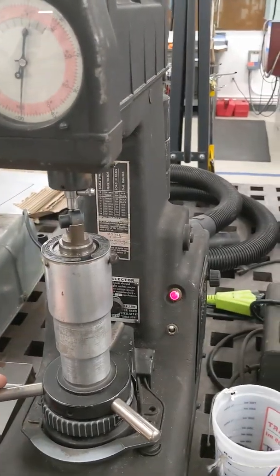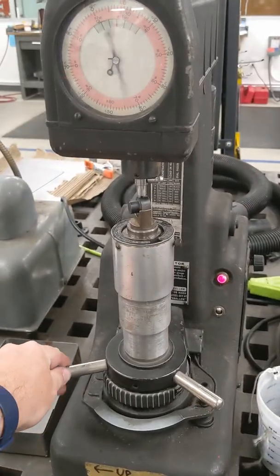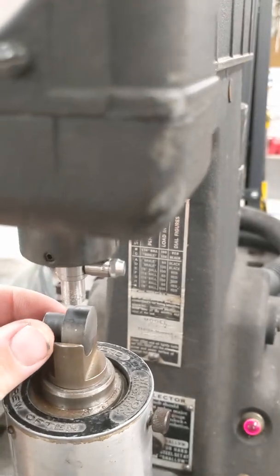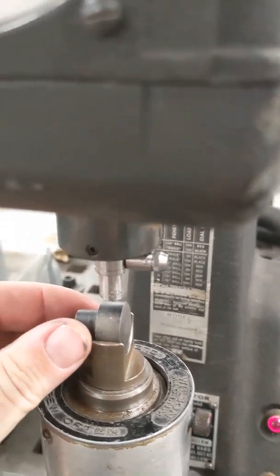Once the test is done, you remove the part by unscrewing this collar. I'm going to run this one more time and make sure I get a similar number.